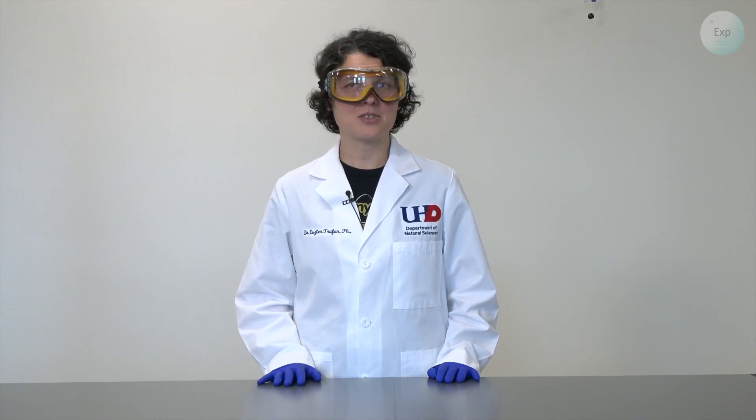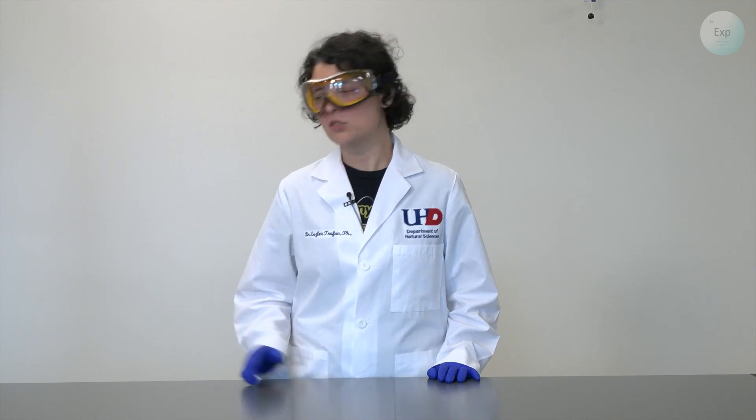Hello, my name is Dr. Esther Trufan and in this video I'm going to demonstrate how to make a stock solution using juice.